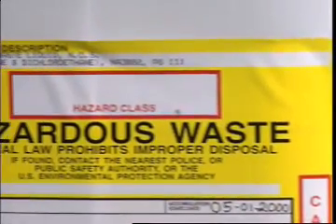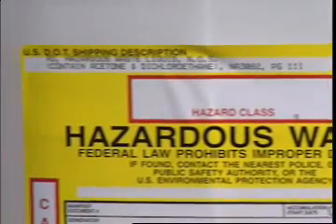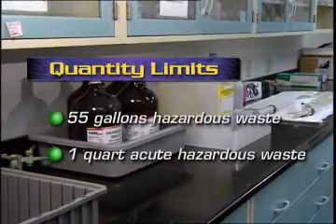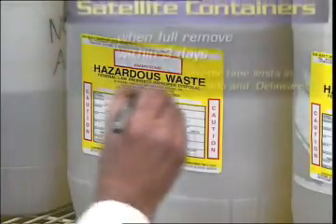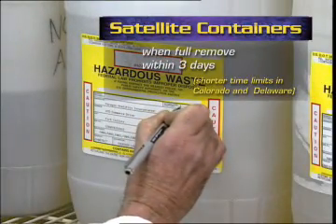When a satellite container reaches the maximum quantity allowed, that is 55 gallons of hazardous waste or 1 quart of acute hazardous waste, the container must be dated and moved from the lab within 3 days.